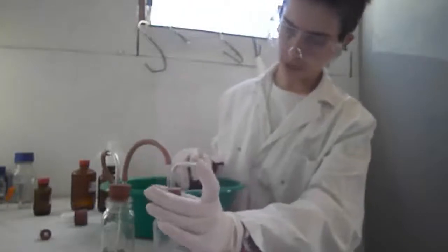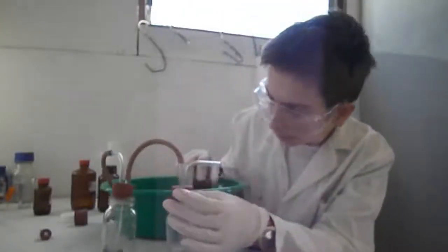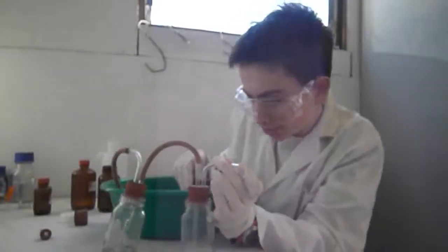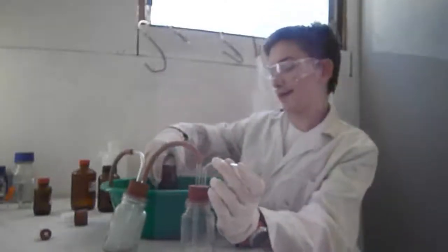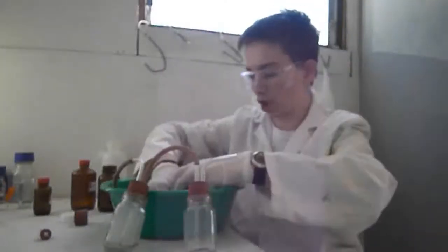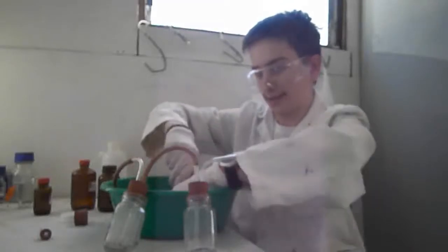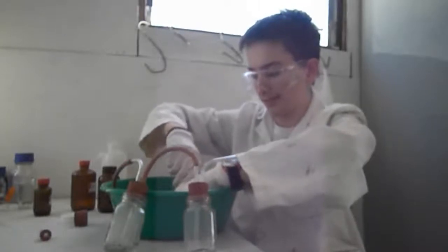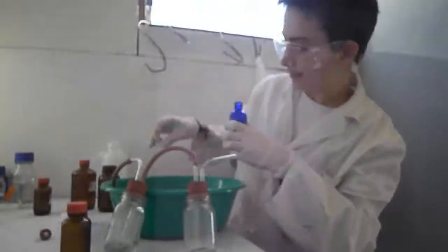So you probably can't see what's going on. That's alright, neither can I. I will start it off and hopefully air will go through. Alright, the process begins. What? Yep, I smell that. And I see the smoke. I'm hoping that's hydrogen. Ew. Hydrogen is invisible, so that might not be good. Whatever that gas was, I was breathing it in. That was not very successful. Let's try again. Hopefully, it's still going.